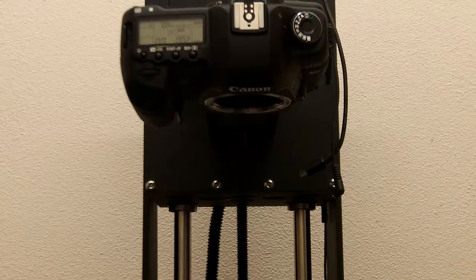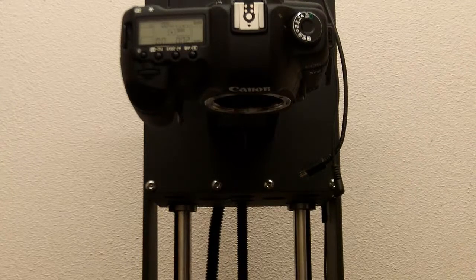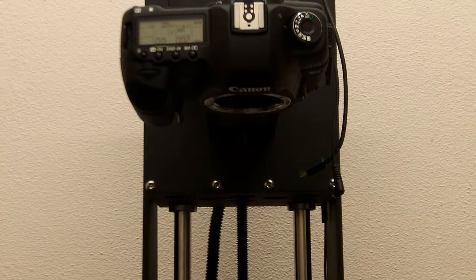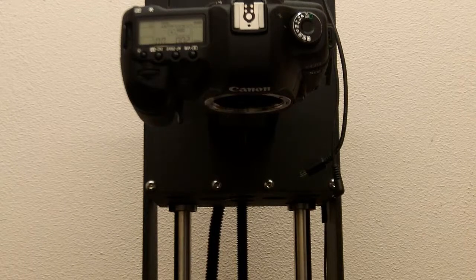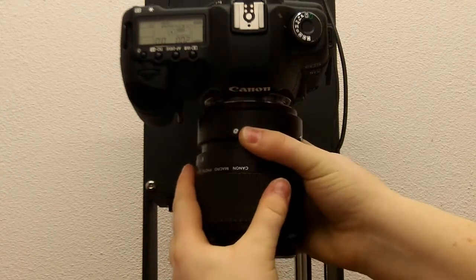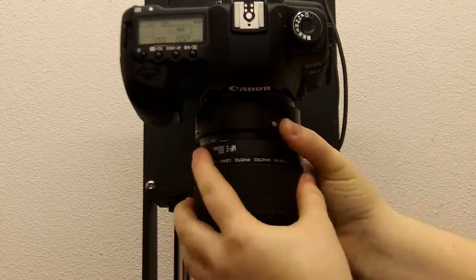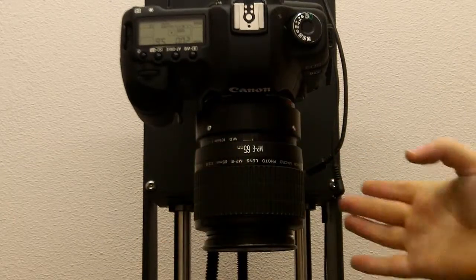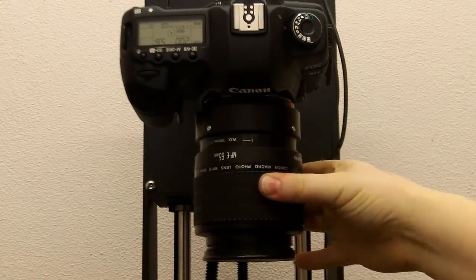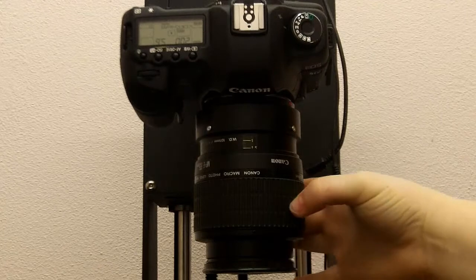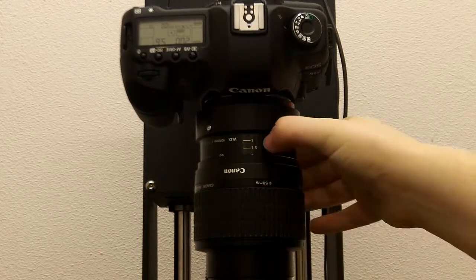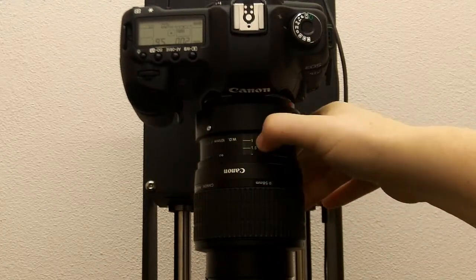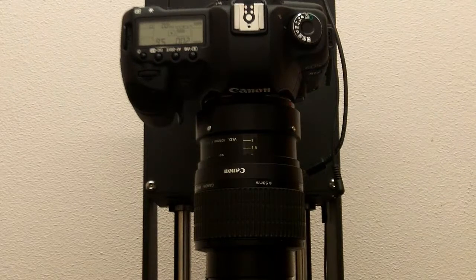So, let's go over how to change the magnification for the 65mm, which is slightly different. So, let's attach the 65mm. And to increase the magnification, you change the dial, same as before, but instead of a ratio format, it's in a multiplication format.